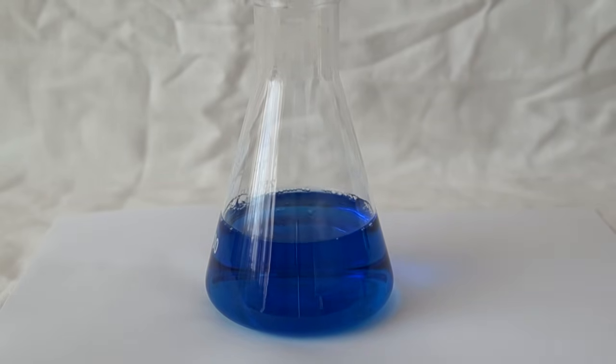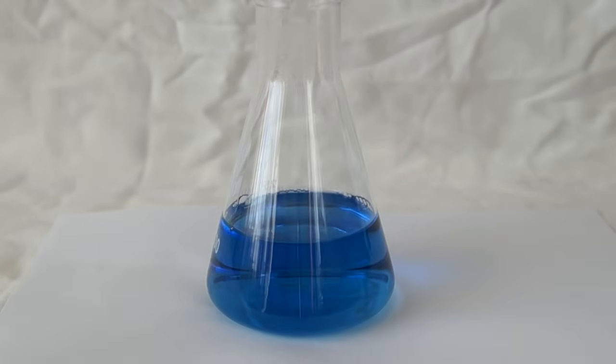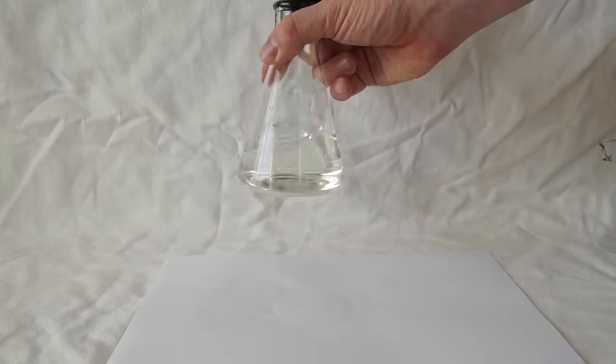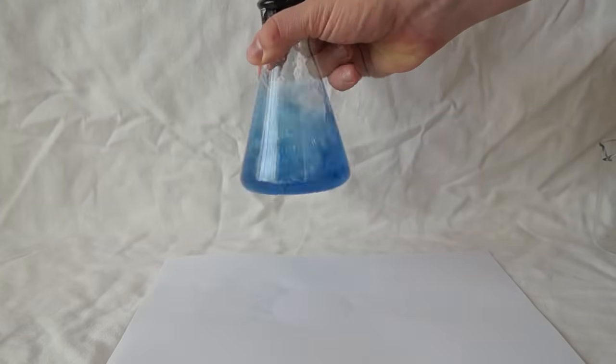When adding the alkaline solution of glucose, the solution becomes colorless. When the solution is shaken, its color is converted into blue.